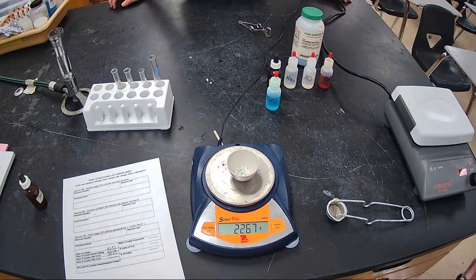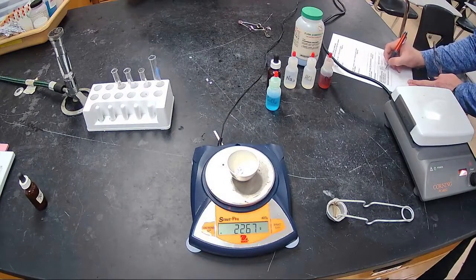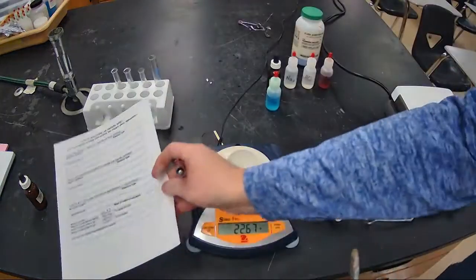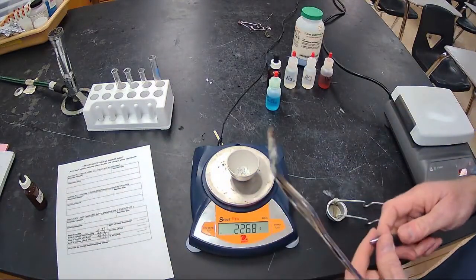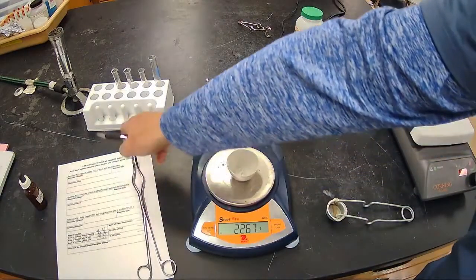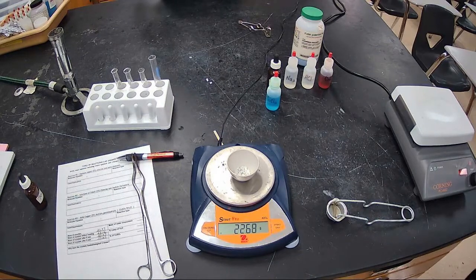What's the purpose of doing it twice? It's lighter than originally, but now it's still 22.67. It looks like we've driven all the water off of it. That was the purpose of that, I think, right? Yep. So still 22.67. Make sure you include that. And now you want to take that, and I want you to figure out what is the percent composition of copper sulfate and water in your mixture, and see if it gets close to what it should be originally.